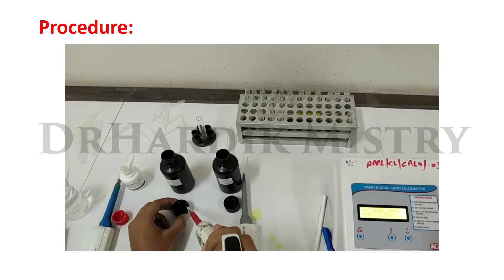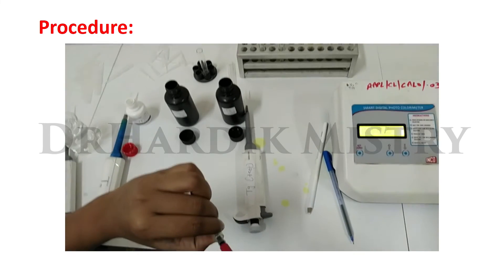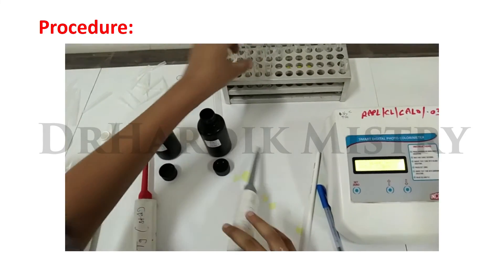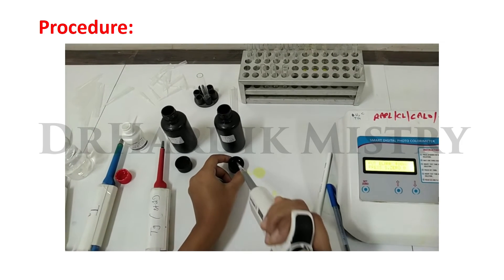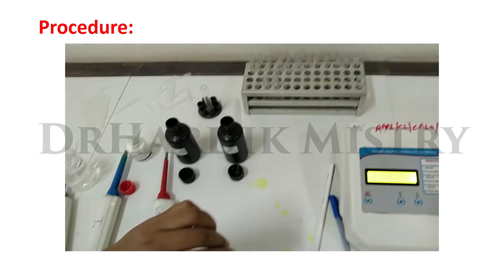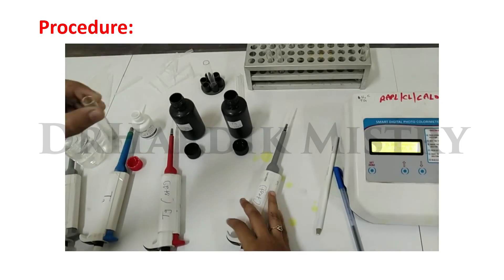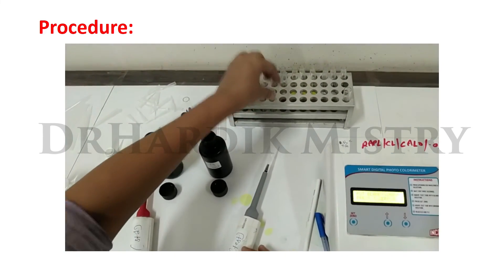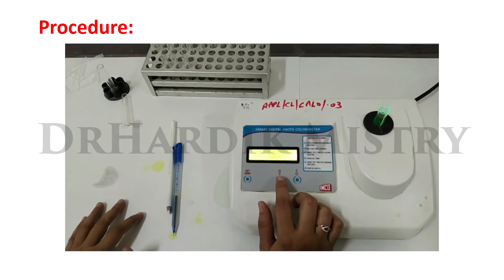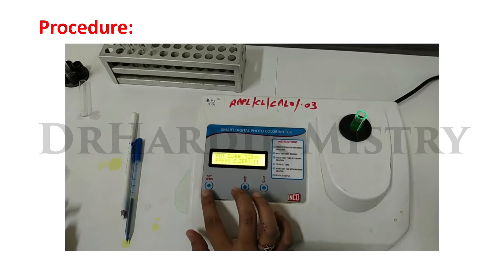Add 10 microliters of standard to the standard test tube. Add 10 microliters of sample to the test test tube. Mix well all three test tubes. Incubate at room temperature for 5 minutes. After 5 minutes, read absorbance colorimetrically at 520 nm wavelength. Now take your readings.